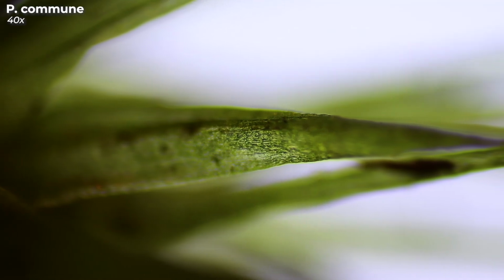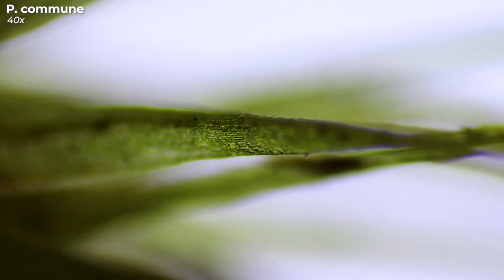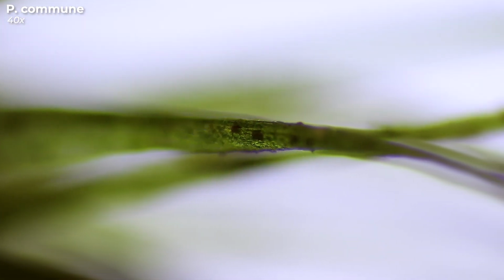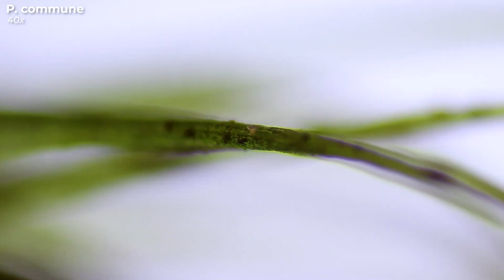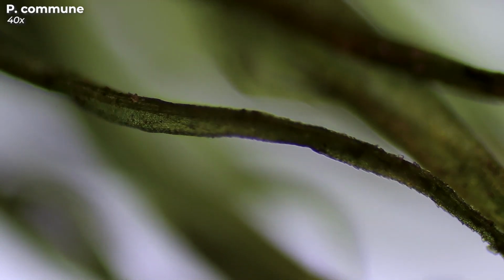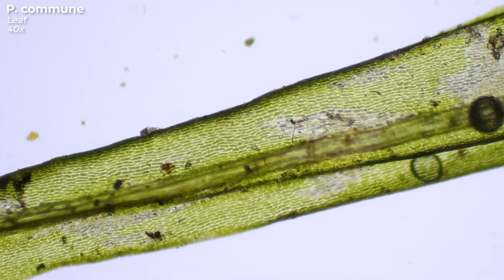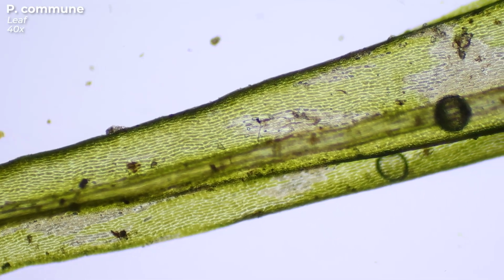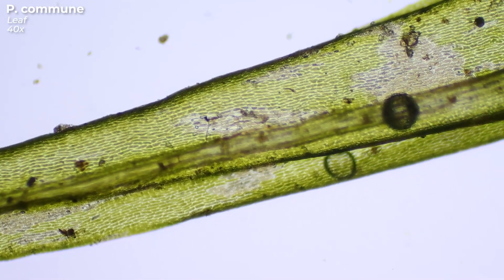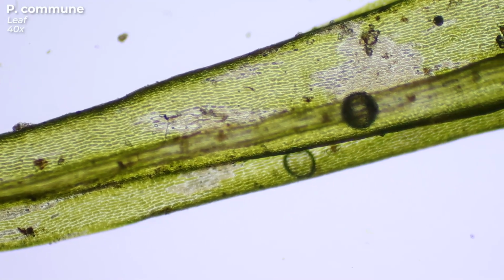The other species of moss I have collected is called Polytrichum commune. This moss can also be found nearly everywhere. The leaves are elongated, serrated and lanceolate in shape. The name Polytrichum is derived from ancient Greek and means many hairs. Therefore, the moss is also known as common haircap or great golden maidenhair.